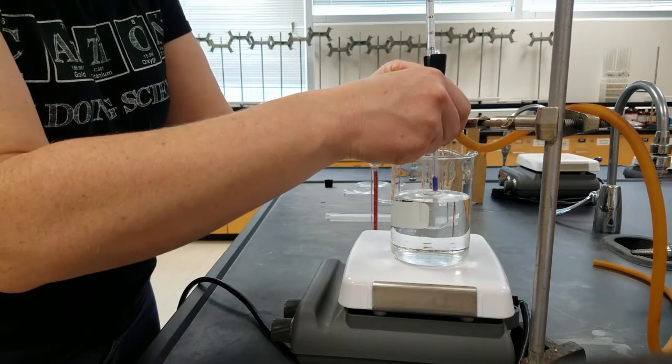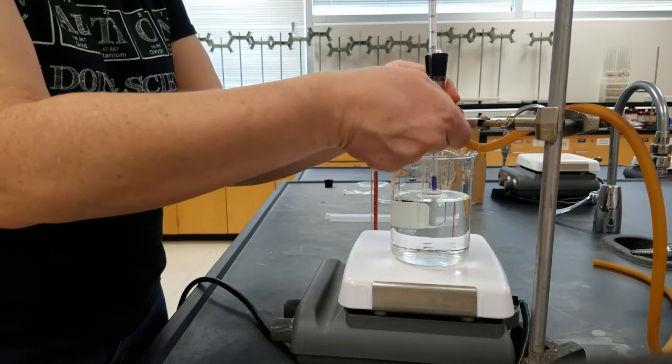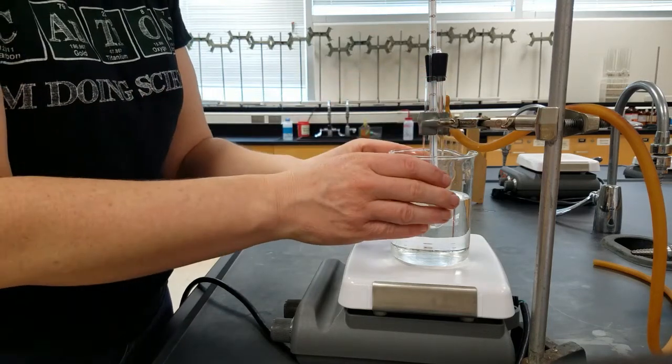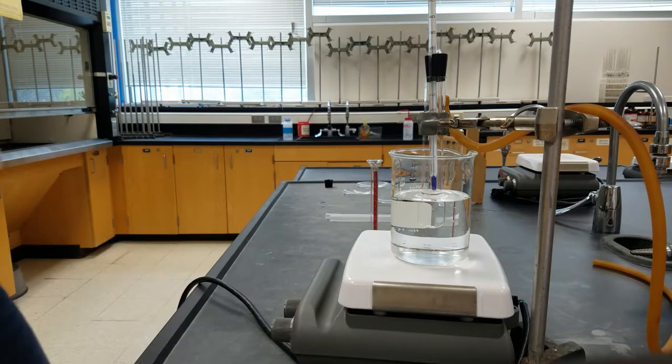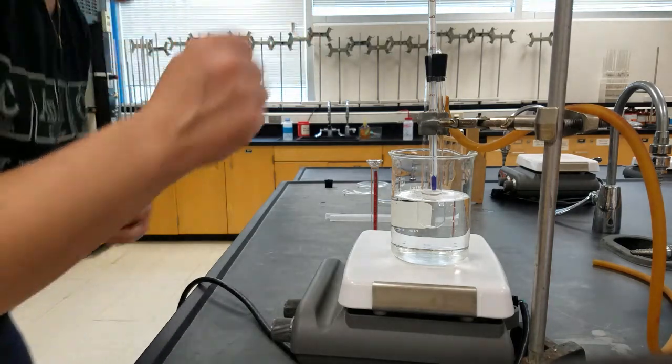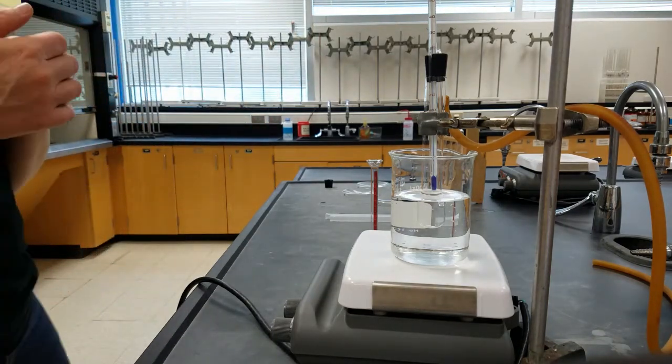And we want the level of our unknown and the level of the water to be just about equal to each other. That way we will determine if the volume is decreasing over time.